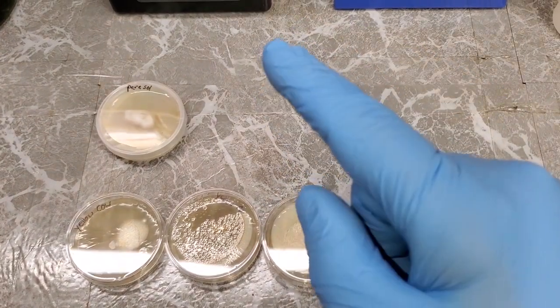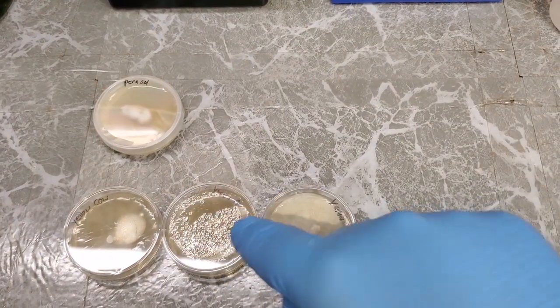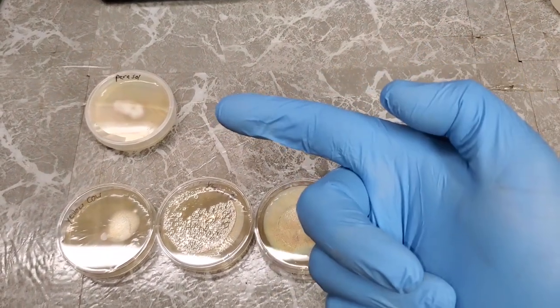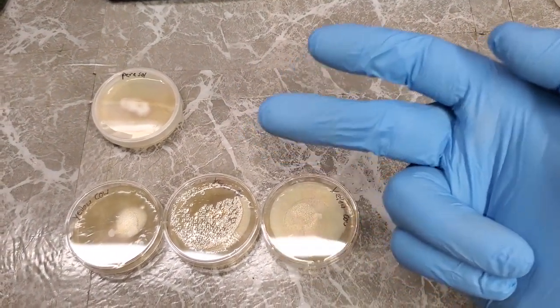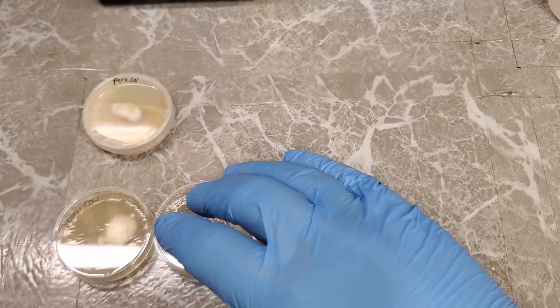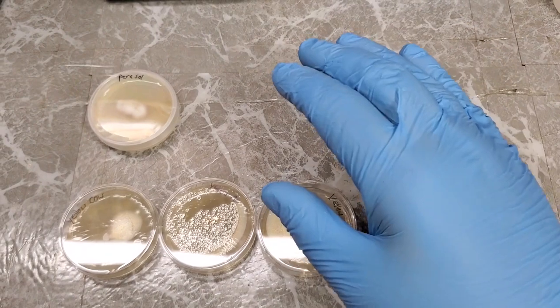This is a video about contaminated petri dish cultures from either wild mushroom cloning samples, agar transfers, spore inoculation, anything that has to relate to culture samples on agar and dealing with contamination. That's what this video is about.